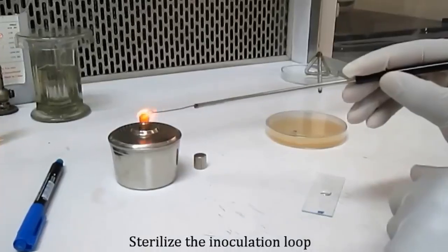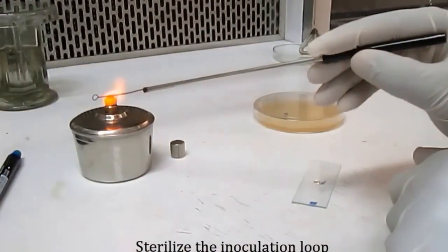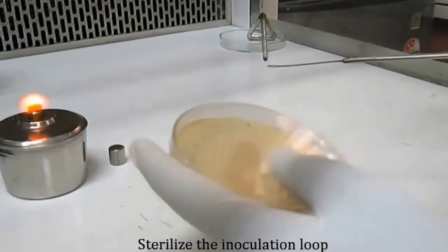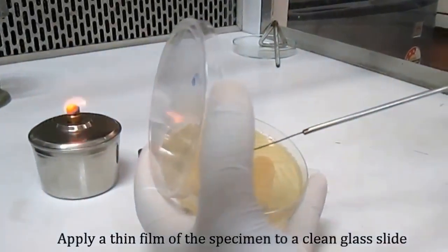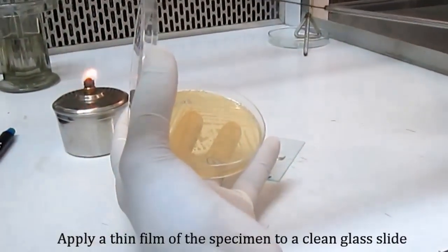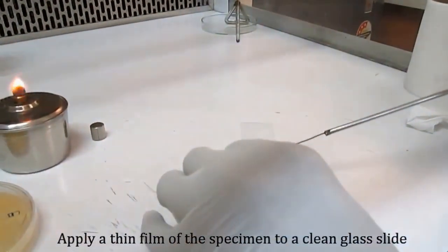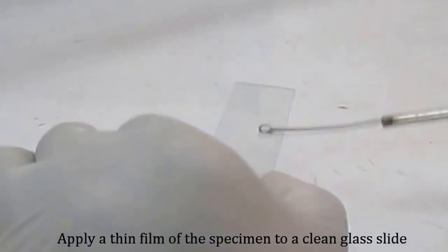Sterilize the inoculating loop by heating it over the flame until it gets red hot. Then take the colonies of bacteria from the bacterial culture with the help of the inoculating loop and place it over the water drop. By slight mixing, form a smear on the slide.